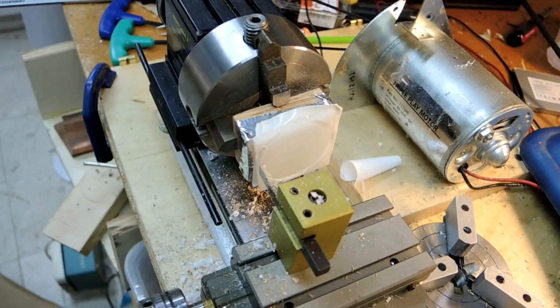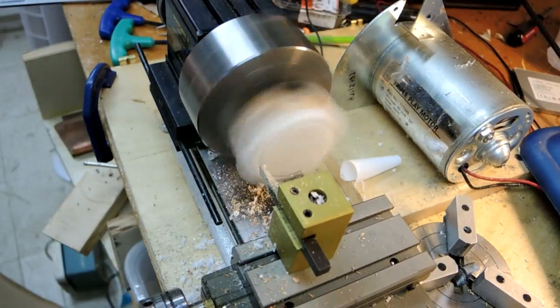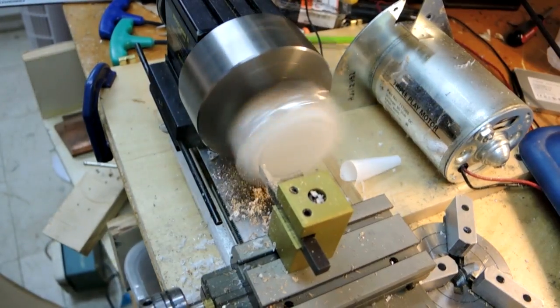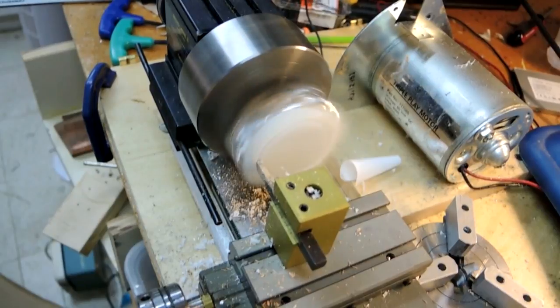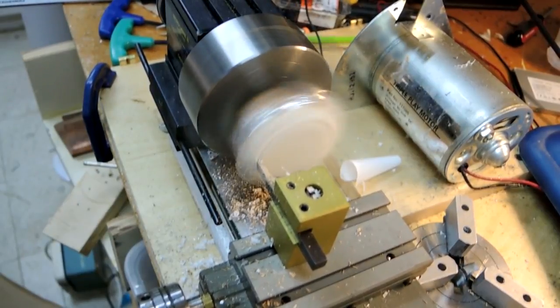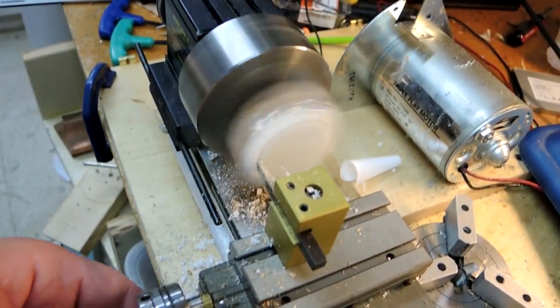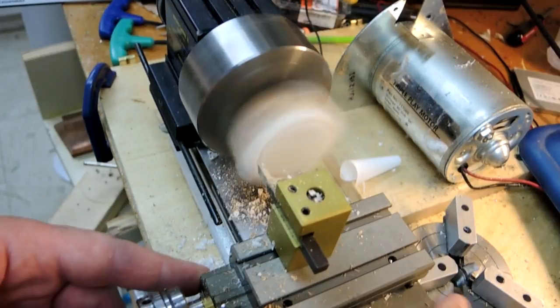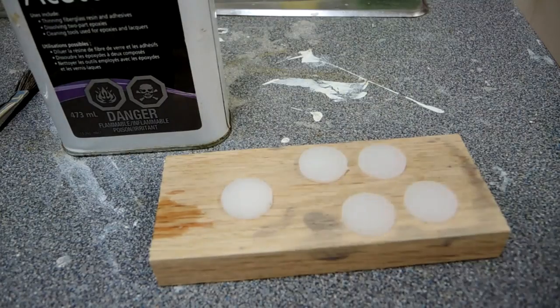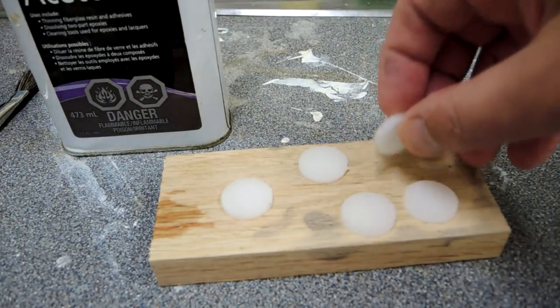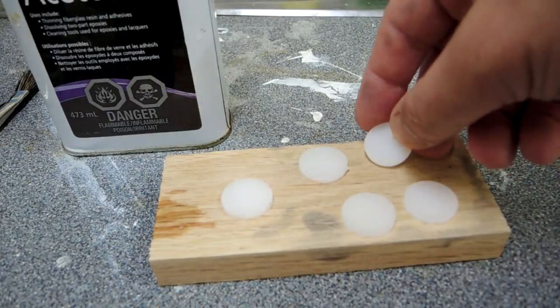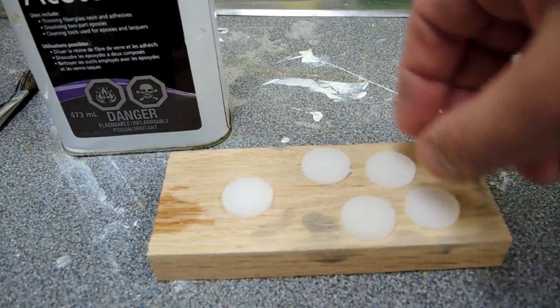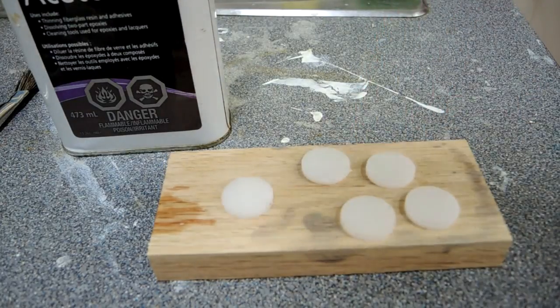To do that I went off and cut some circular discs out of some white plexiglass. You can see on the chuck there I taped onto an oak holder some plexi. I don't have a proper face plate that you would normally use for lathe but it worked okay. The next thing I had to do was to take that plexiglass disc and create a much larger, much thicker assembly.